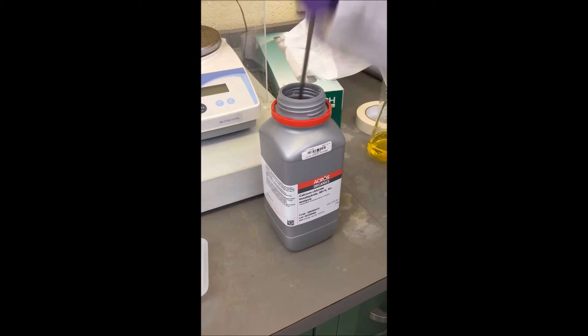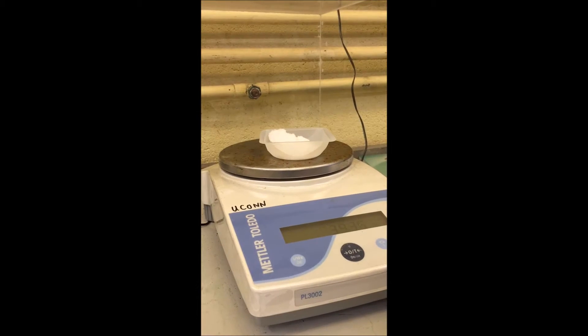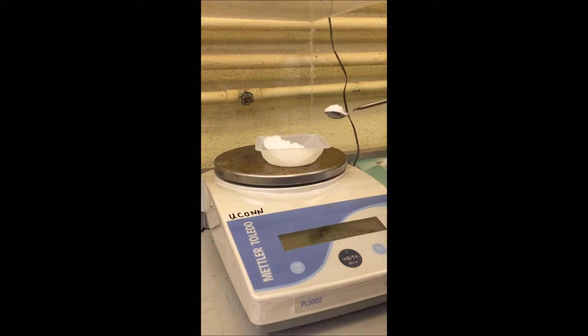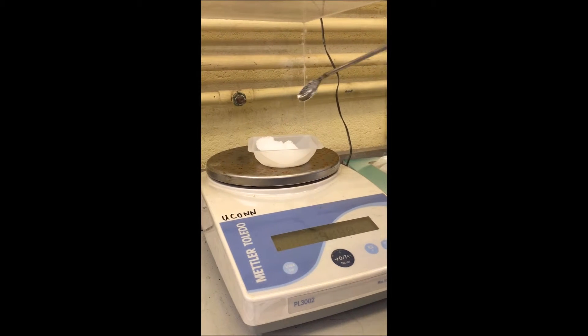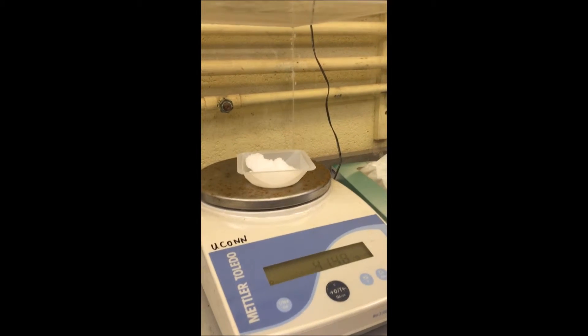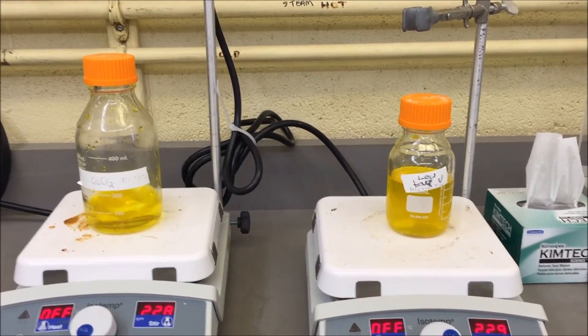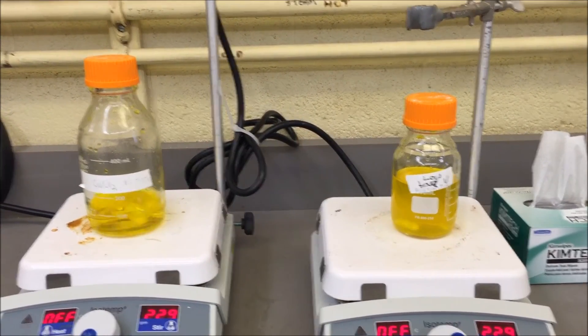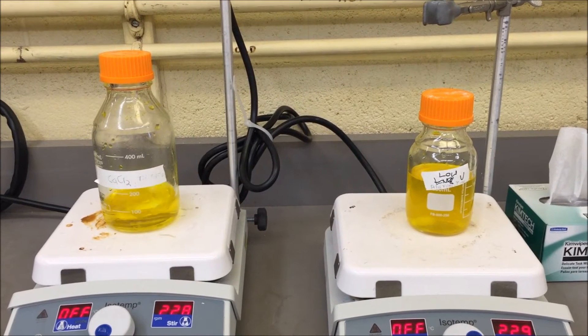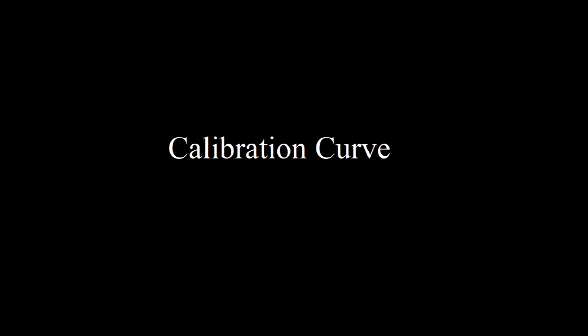The first step is to make the calcium chloride solution. Make sure to crush the powder before putting the calcium chloride into the weighboat. Tare and measure the desired amount of calcium chloride. In order to dissolve your solution, place a stirring rod in your beaker that has your mixture and place it on a stir plate until no solids are seen. Repeat steps for solution 3.